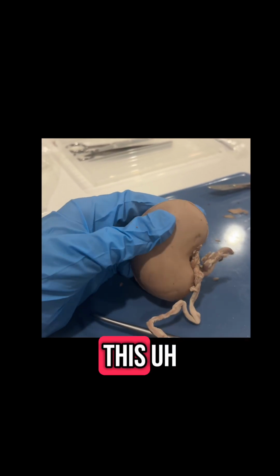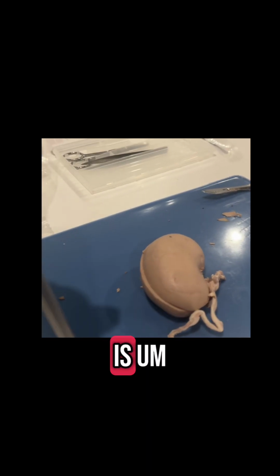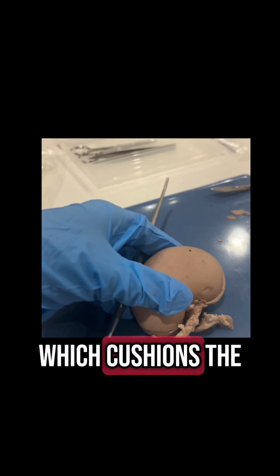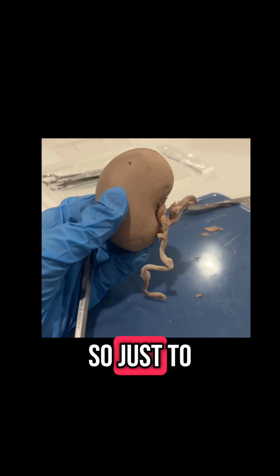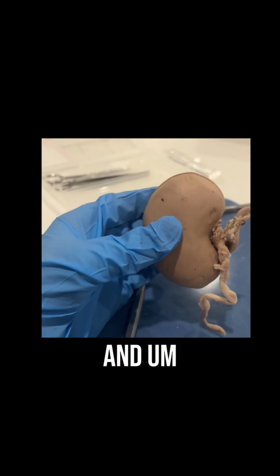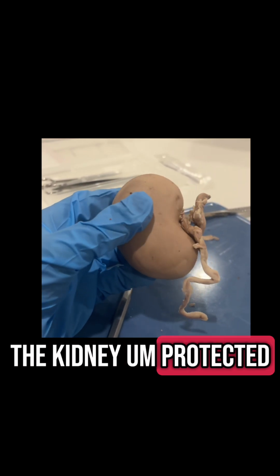And then surrounding this so-called renal capsule is going to be a layer of fat, which is called the adipose capsule, which cushions the kidney and holds it in place inside the body. So just to go over the renal capsule again, it's made out of connective tissues and keeps the structures that are inside of the kidney protected.